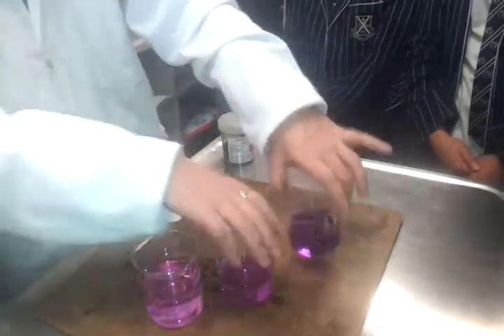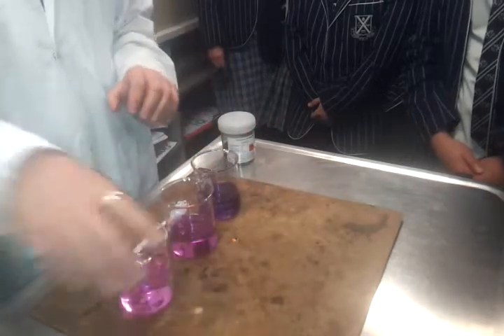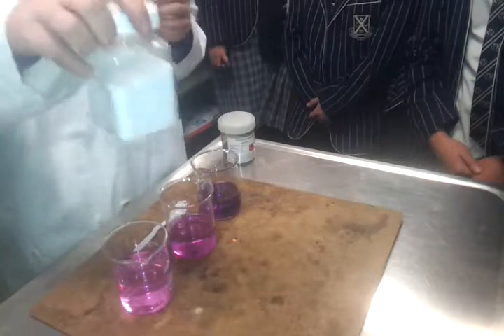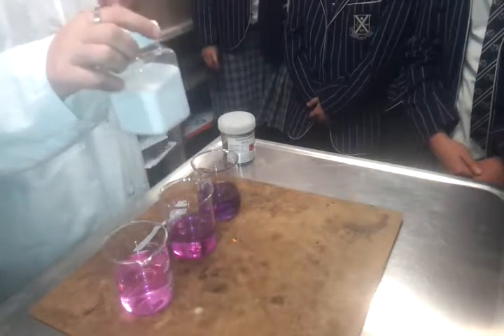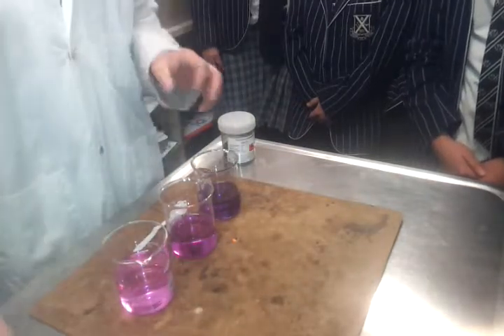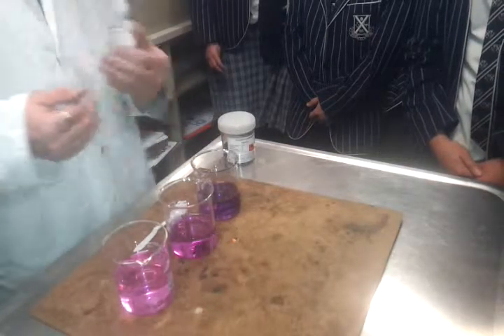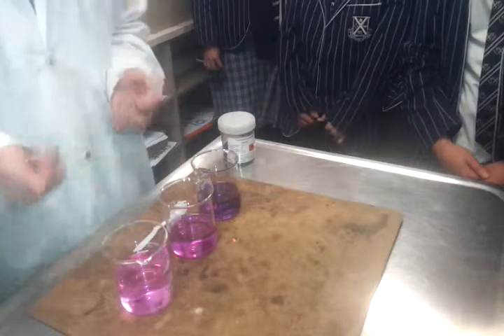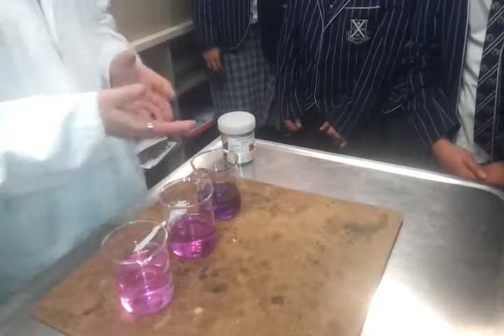The thing is, what you're going to look at today is going to be using powders that don't have a colour, they're white. So if they do dissolve, they actually make no colour in the solution, so we can't see that. So normally in chemistry, we have to use different things like indicators and so on to work out if things are more dilute or more concentrated.